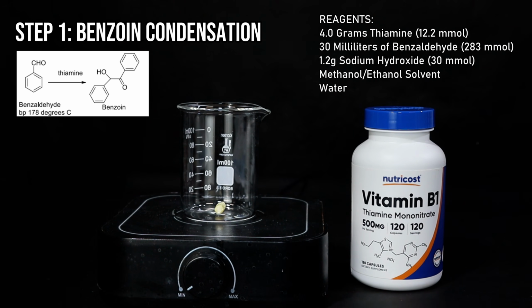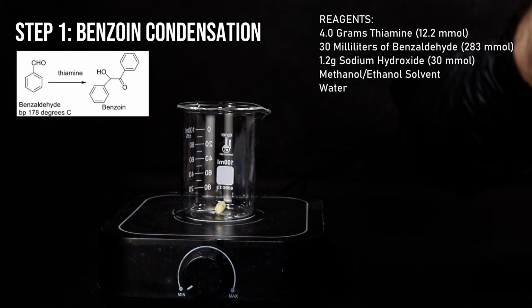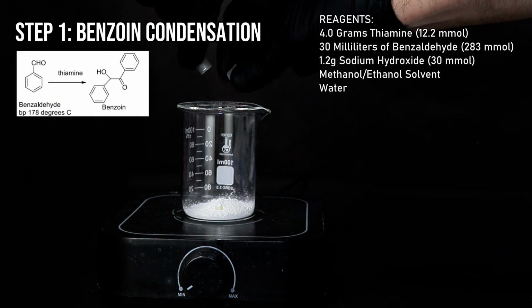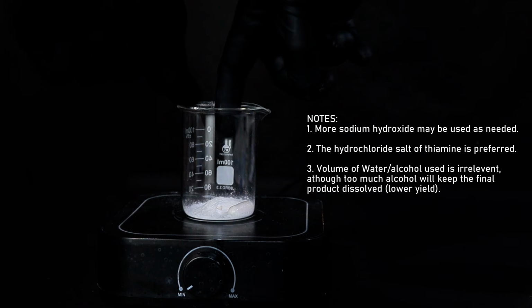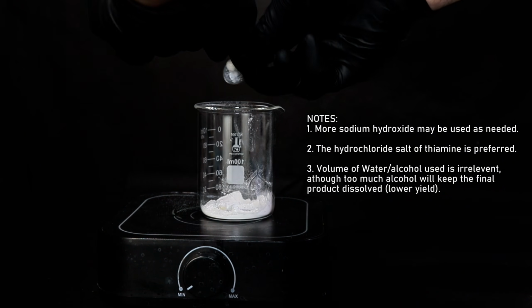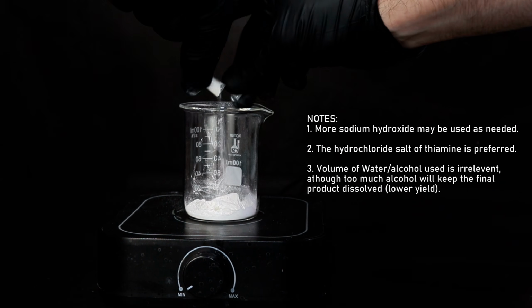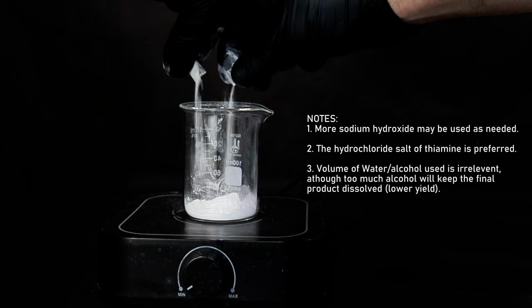cells. Now, to get started, I needed about 4 grams of thiamine nitrate, and since a single capsule contained 500 milligrams, I went ahead and broke apart 8 of them and transferred the powder to a beaker. The more common thiamine hydrochloride is preferred here, but for some reason my pharmacy only had the nitrate salt. The main benefit of the hydrochloride salt is that it's far more soluble in water and alcohols, while thiamine nitrate has a hard time dissolving to any meaningful extent.